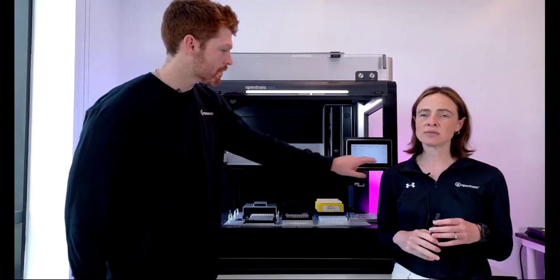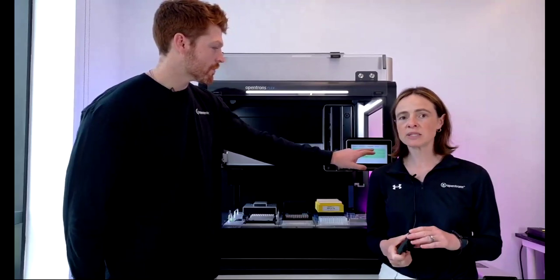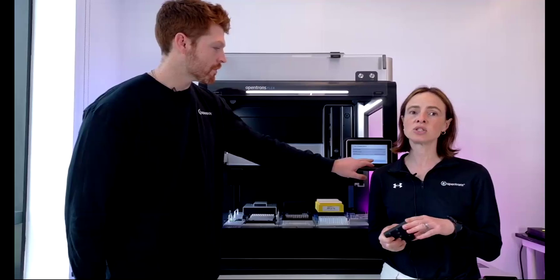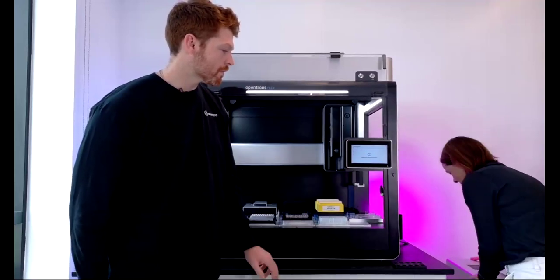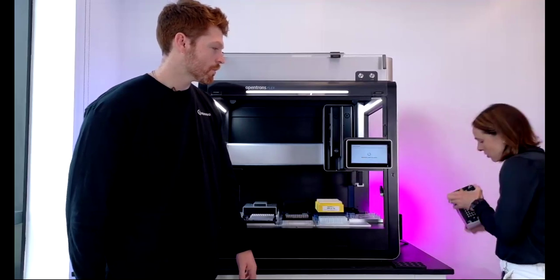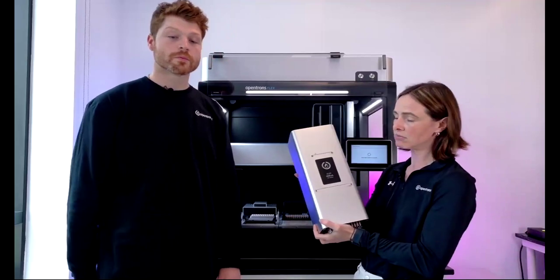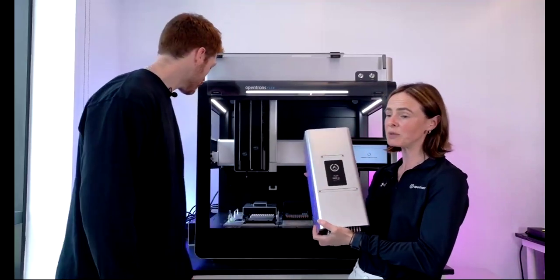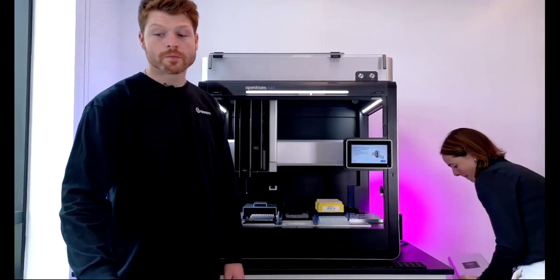I will just say, as a note, that it's very easy with the single and 8 channel pipettes. The 96 is also quite straightforward. It's just a much heavier pipette. We actually have it here. Lift it in. So it's still the same. You can still swap it in and out yourself, but it's just chunky, and you definitely need 2 people to do it. Great. Speaking from experience, I have installed the 96 by myself. I am not particularly strong, so it's definitely doable.